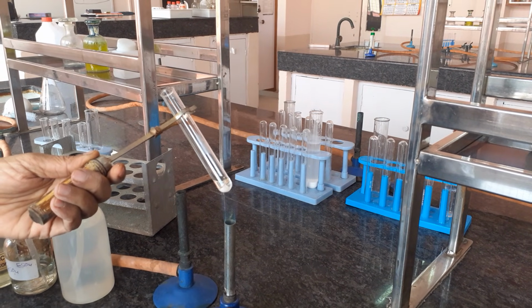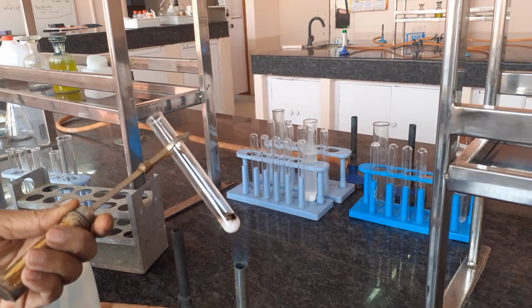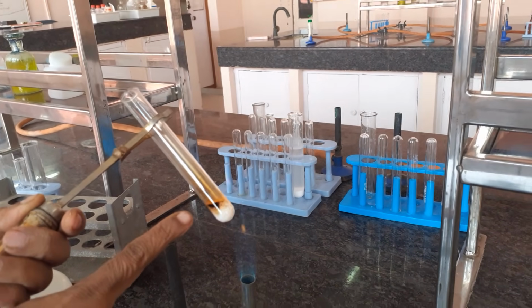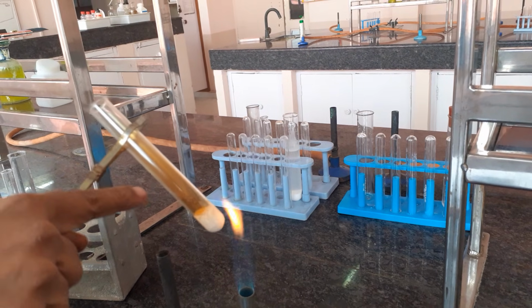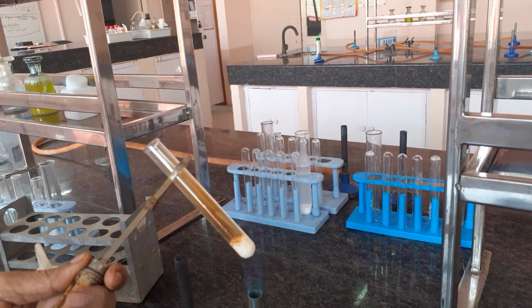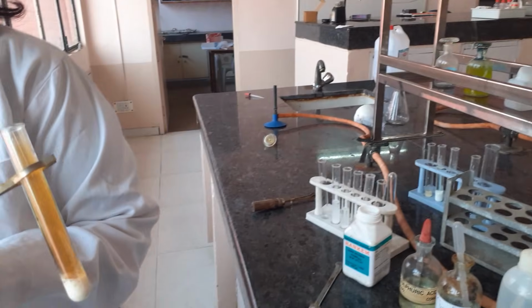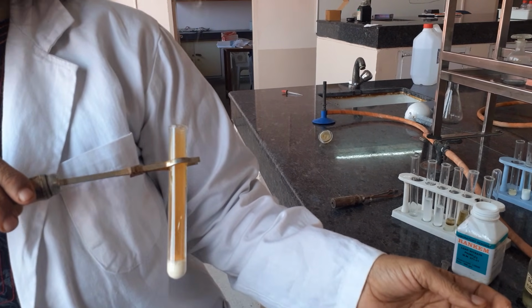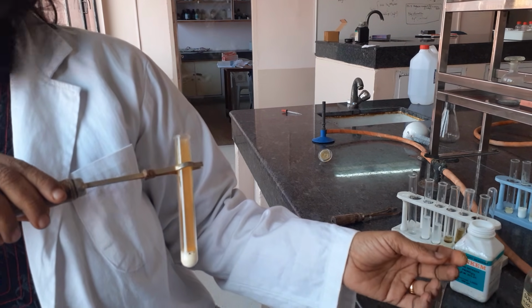On heating this, the salt of lead nitrate reacts with concentrated sulfuric acid and the piece of paper. Can you see the black piece of paper? This is the carbon of the paper. Now can you see a brown gas evolved here? It is this brown gas which you have to observe. This gas is NO2 and your salt has probably got the anion nitrate. You can better see it on the lab coat background, the brown gas evolved, and at the bottom you can see the reaction happening.